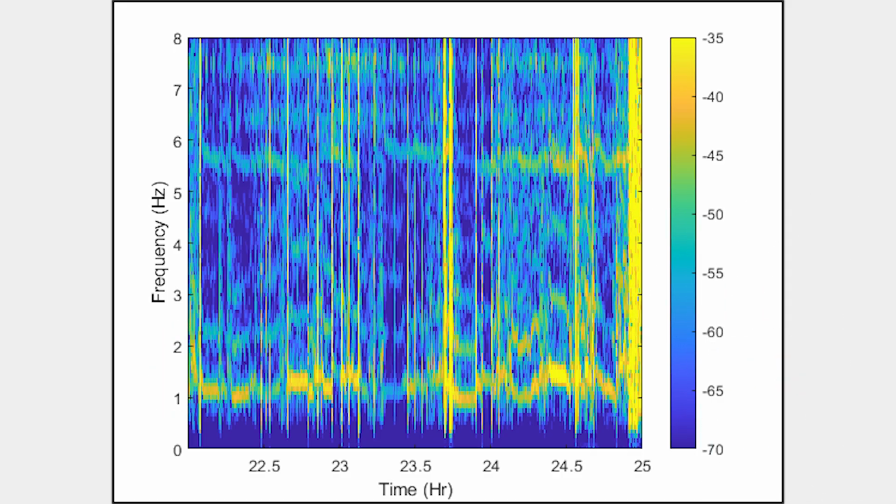Now we will look at the signals that are corrupted by noise sources that are typically found in cage setups and can reduce performance.